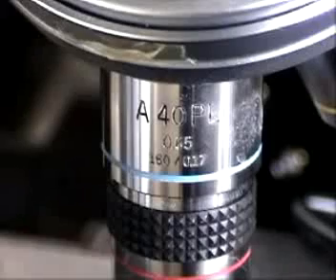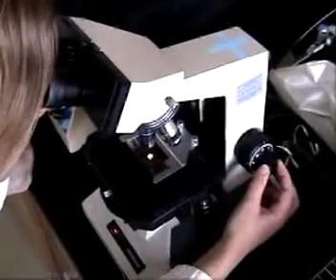Remember that our microscopes are parfocal, so you should be able to swing the 40x into position without having to adjust the focus but a little bit.